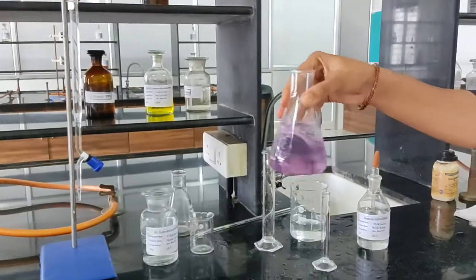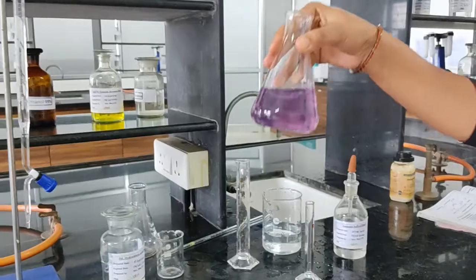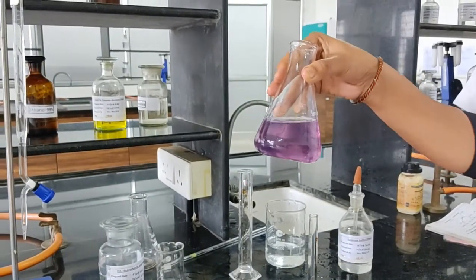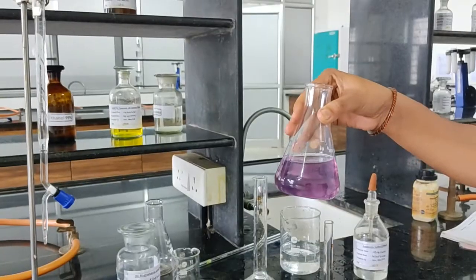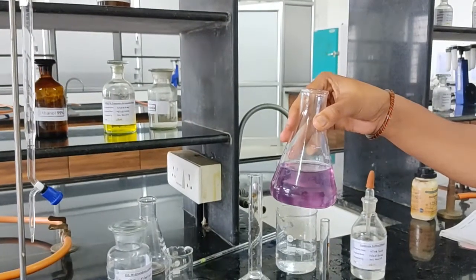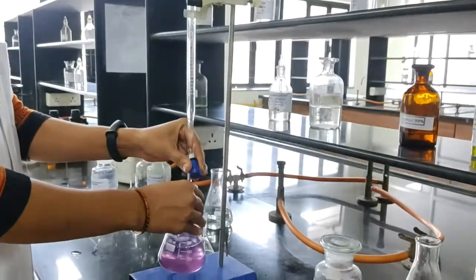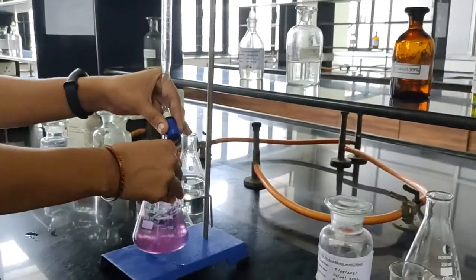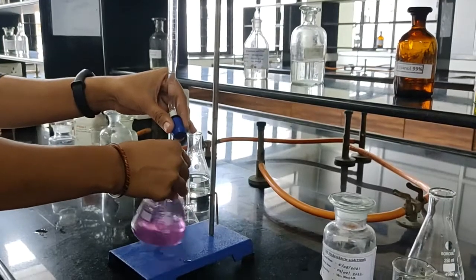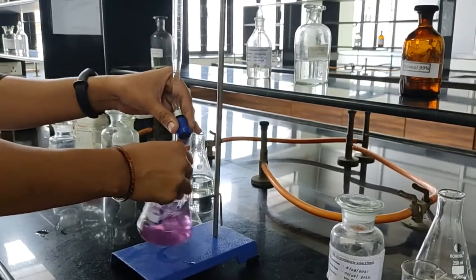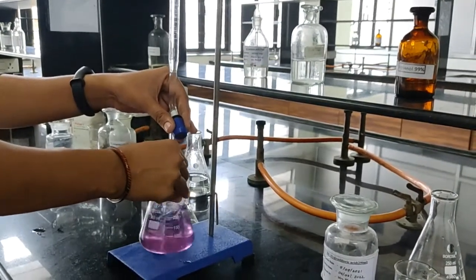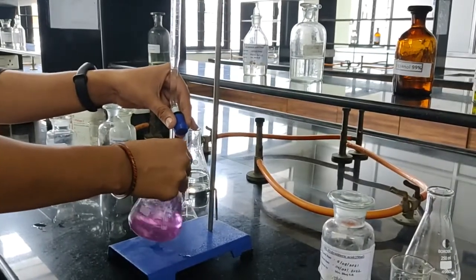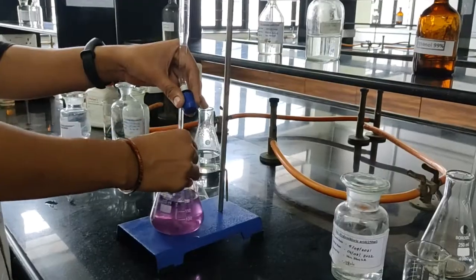After addition of Mordant Black Second we got pink colored solution. Now titrate the solution against 0.05 molar di-sodium EDTA. During titration shake the solution properly. So reaction must occur properly. Our end point is pink to blue.